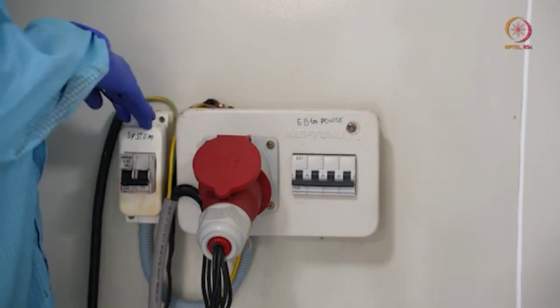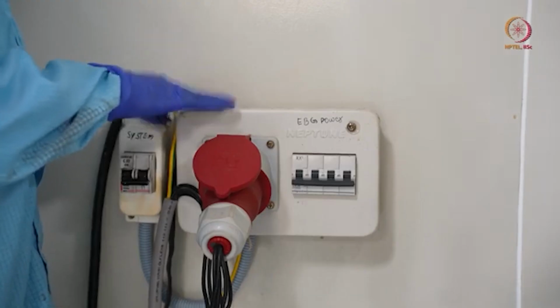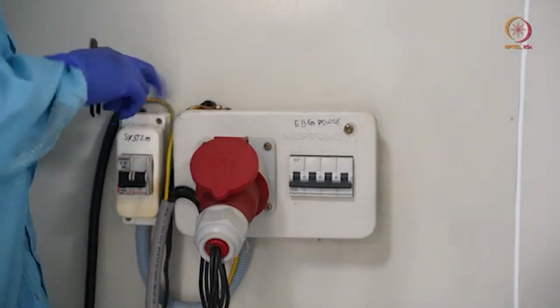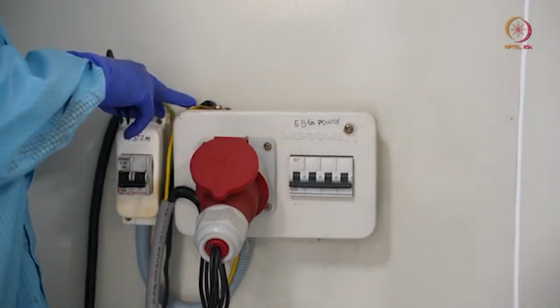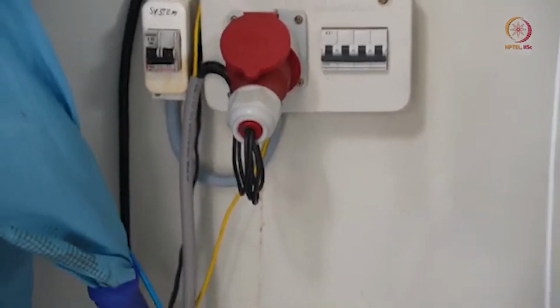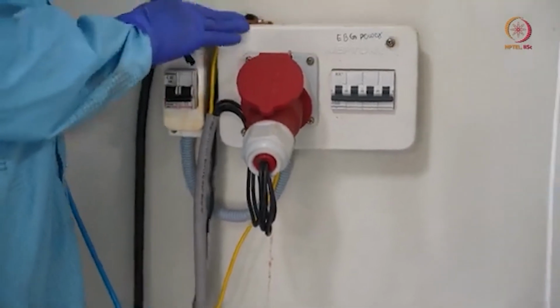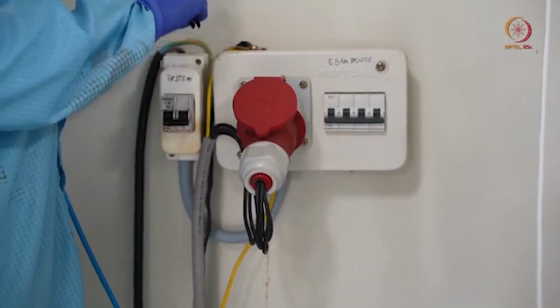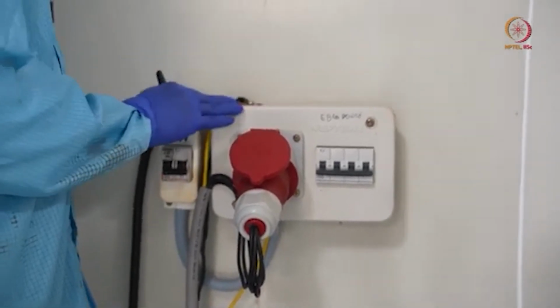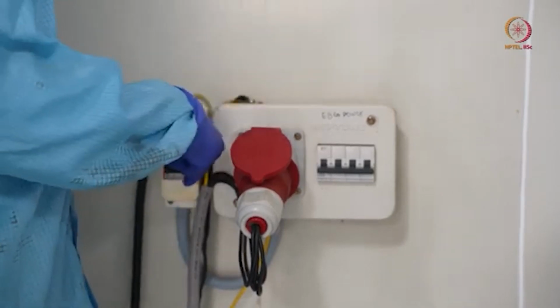This is just like a 230 volt normal connection as we use, and this is to support a 5 kilovolt transformer. So this has a better arrangement for this, and one inbuilt ground line. You can see the copper strip here, which is going as earthing. We will switch on the EBG power only when we are about to deposit something, otherwise this should be off, just to avoid electrical hazard. And this is the system power that we will be switching on now.